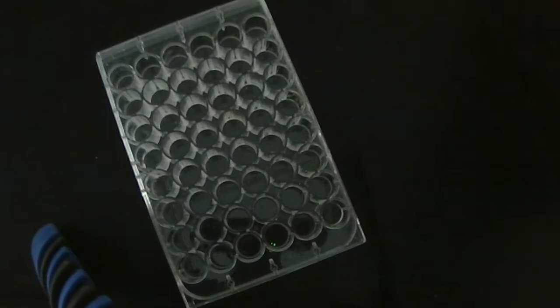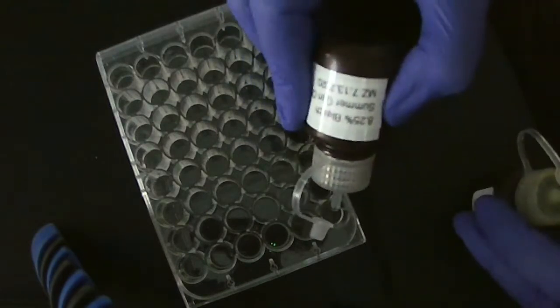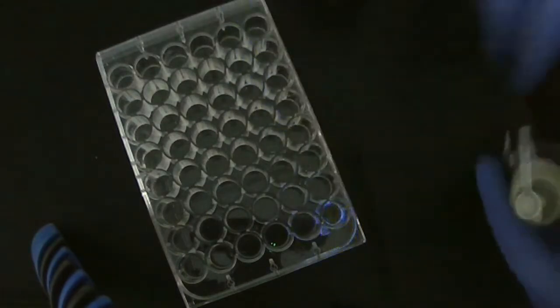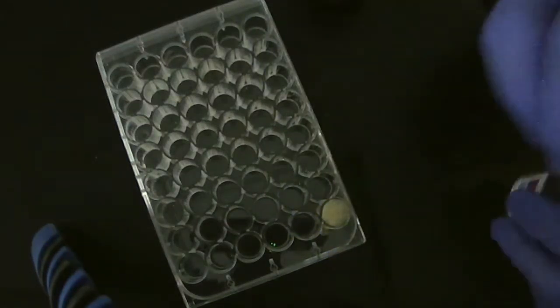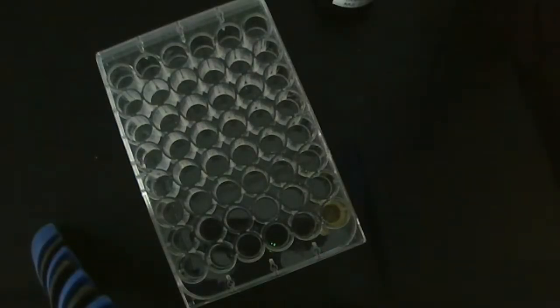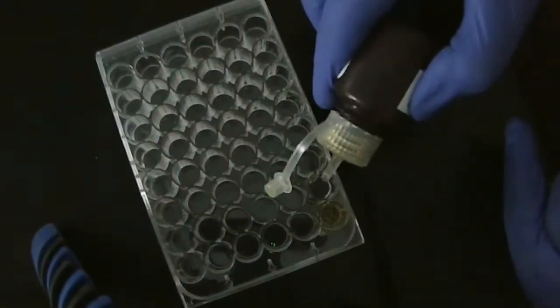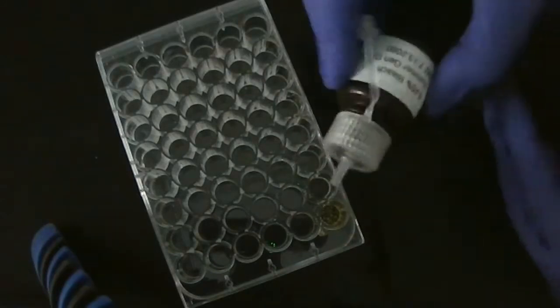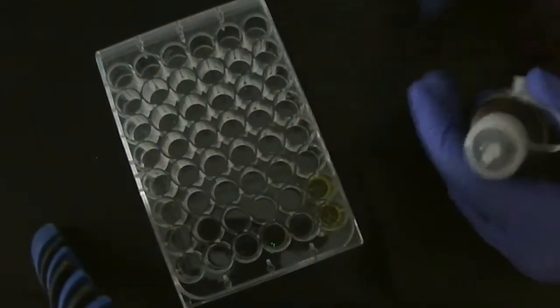Okay, luminol. That's luminol. And then this is bleach. 1, 2, 3. And this is hydrogen peroxide. And I'm doing 3 drops. Okay. So that's the first one. Now we're going to do luminol, hydrogen peroxide, and bleach. The next one, we're going to do hydrogen peroxide, bleach, and luminol.